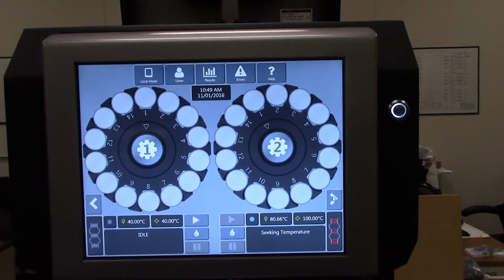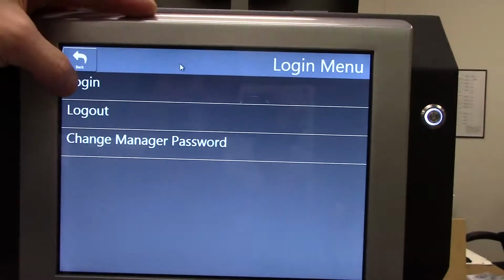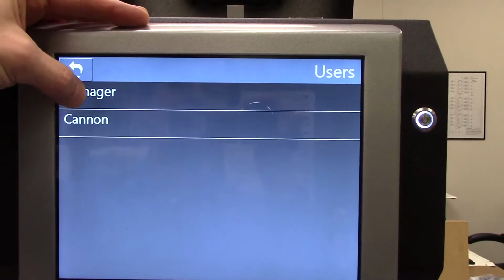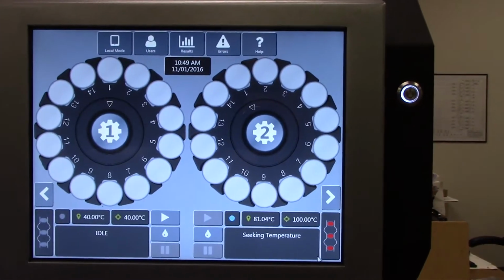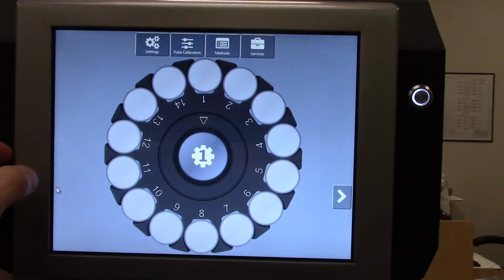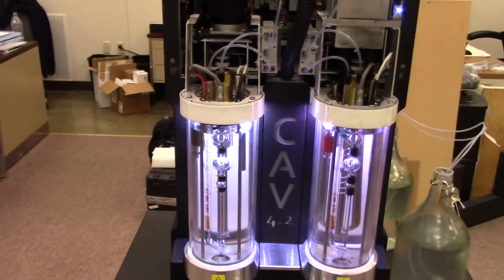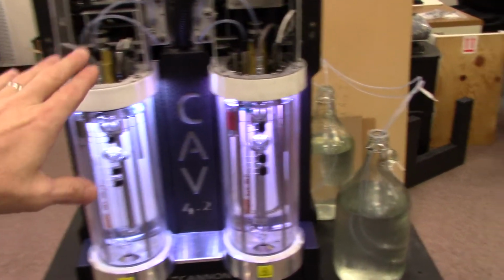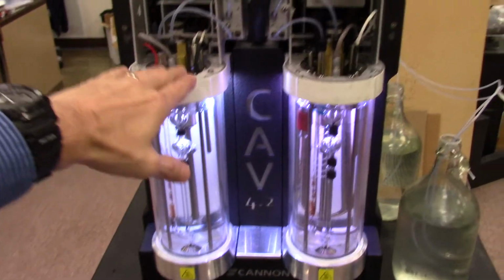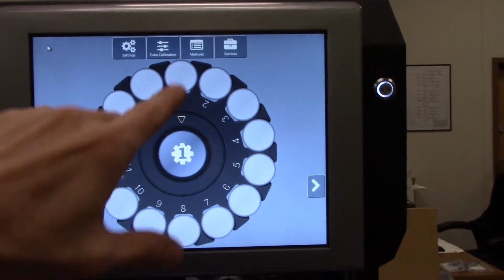The first thing you need to do is log in as the manager. Manager has no password. Then choose the side, the bath, that you want to adjust the sensor on. In this case we are going to adjust bath 1. So we slide the screen to bath 1.